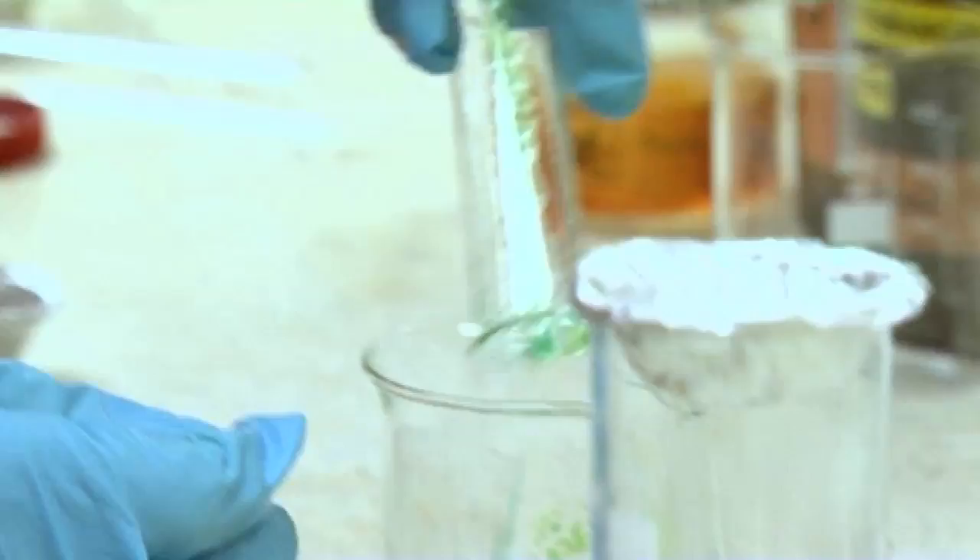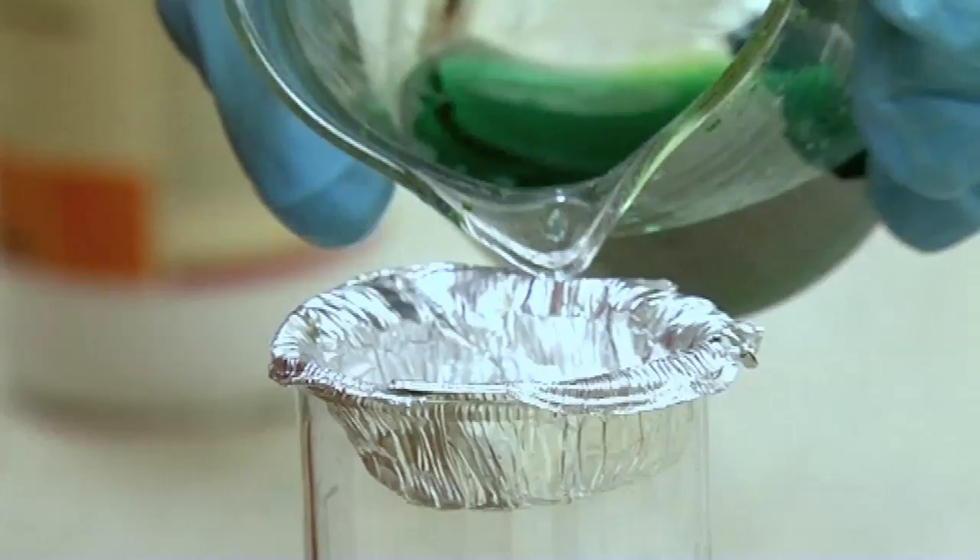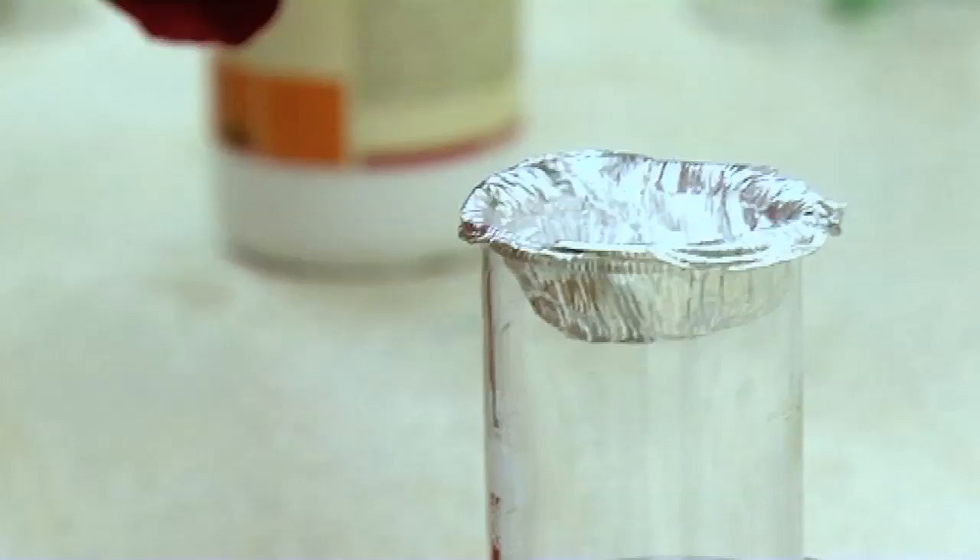You can see it's a long time since I've done such things. We're making up a concentrated solution of copper chloride. It's now mostly dissolved and it's a really very pretty colour. I'm going to place this here. Imagine I'm doing this on the floor of our living room, which has a carpet on it, and the cupcake holder was on the carpet.